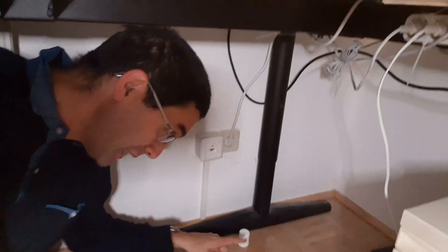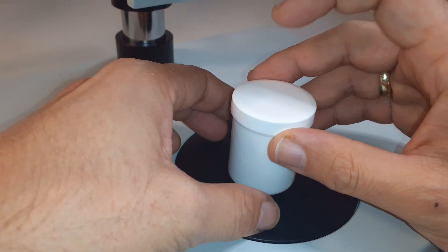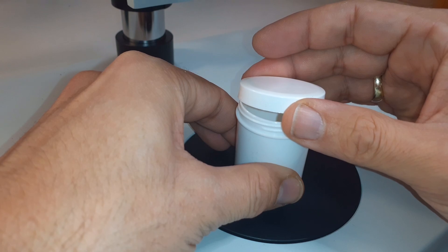I was lucky - here under my table I did find a silverfish finally, after some searching. Now silverfish are wingless insects, meaning they don't have wings. They're insects, so they should have six legs. What I'm going to do now is put the silverfish I caught under the microscope and have a careful look at it.